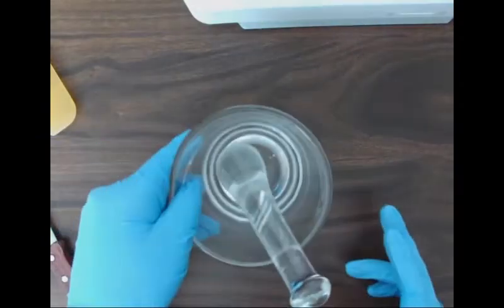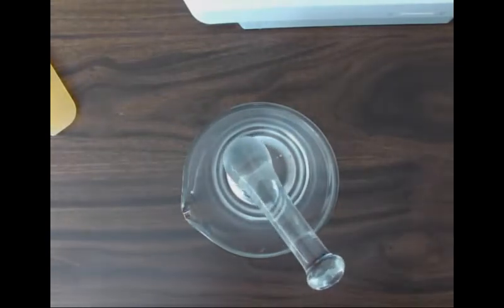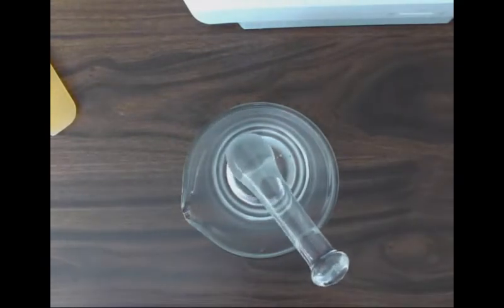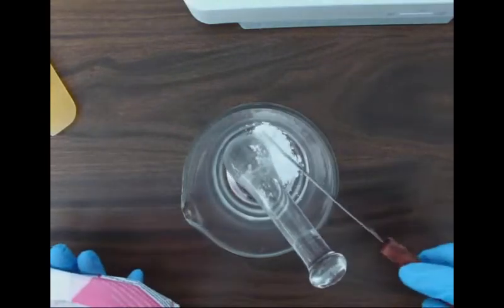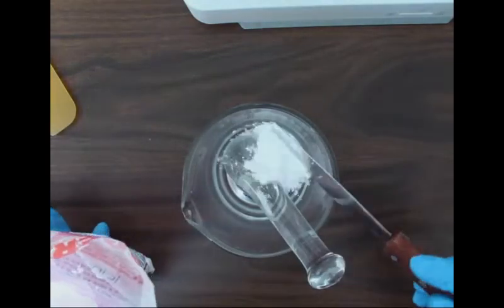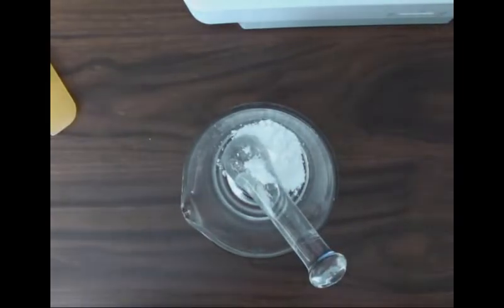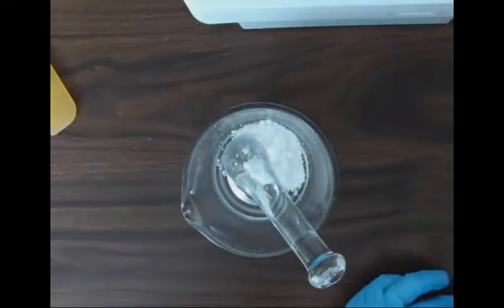I've got it pre-measured on the side here. Okay, so because that's liquid, the things that we're going to be mixing together, it doesn't make sense to do it on an ointment pad or an ointment slab. So I will be mixing this in a mortar and pestle, which is quite common. Okay, so this is my 5 grams of diclofenac, icing sugar. And again, I don't have a scale, so I'm just kind of eyeballing it. But the technique is going to be the same. In lab, of course, you would measure it and get a check.